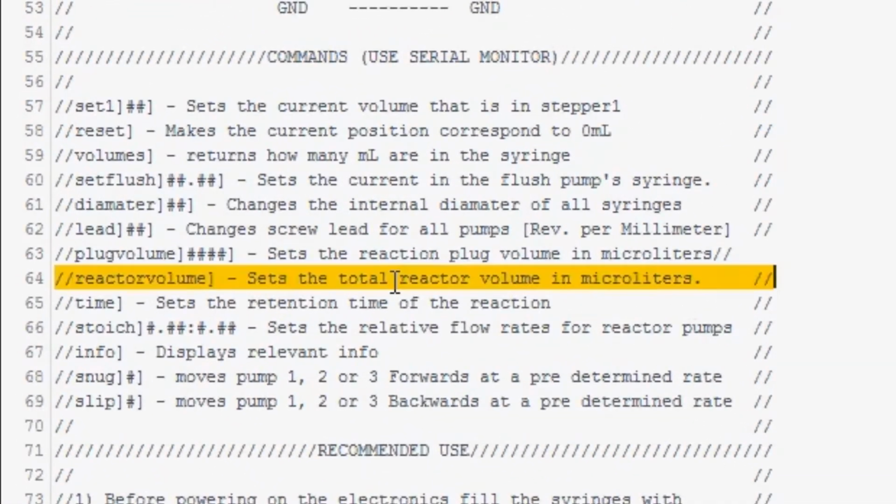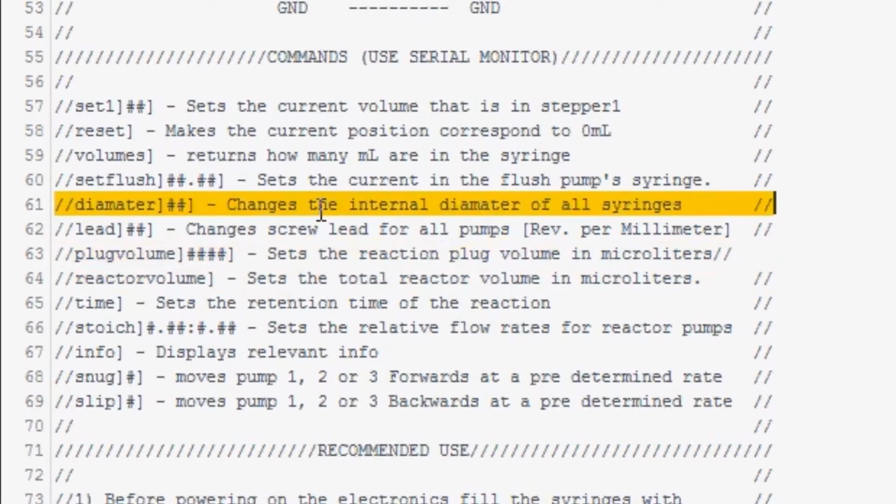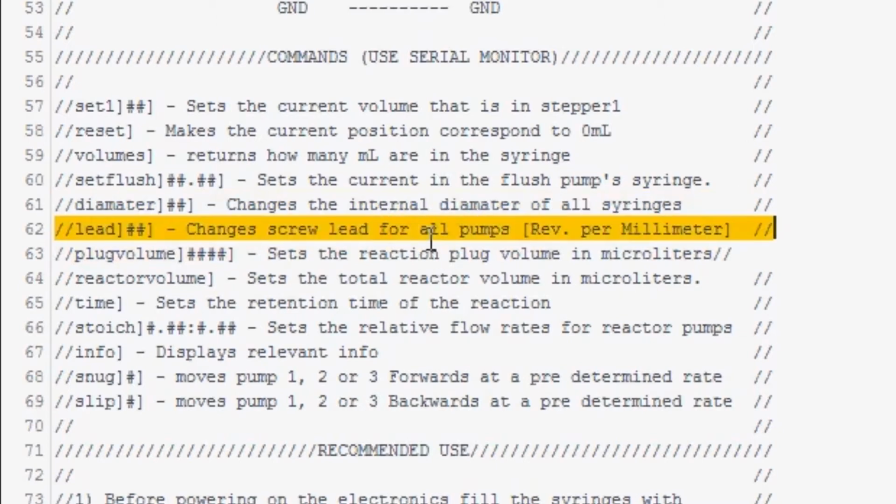Now let's take a look at the commands and the variables that they control. Reactor volume holds the total volume of the reactor in microliters. This is also the volume that the flush pump, or the solvent pump, will dispense after the plug. Plug volume holds the volume of the plug. Diameter changes the internal diameter of the syringe, allowing you to use different size syringes. Lead changes the thread density of the lead screw. This allows you more flexibility when building the pumps. You can use metric or imperial. It doesn't matter so long as you inform the microcontroller.